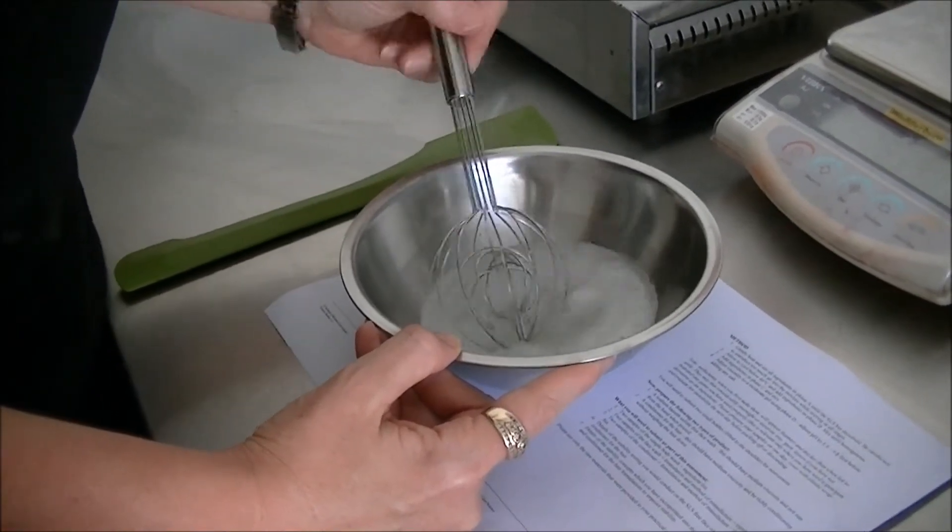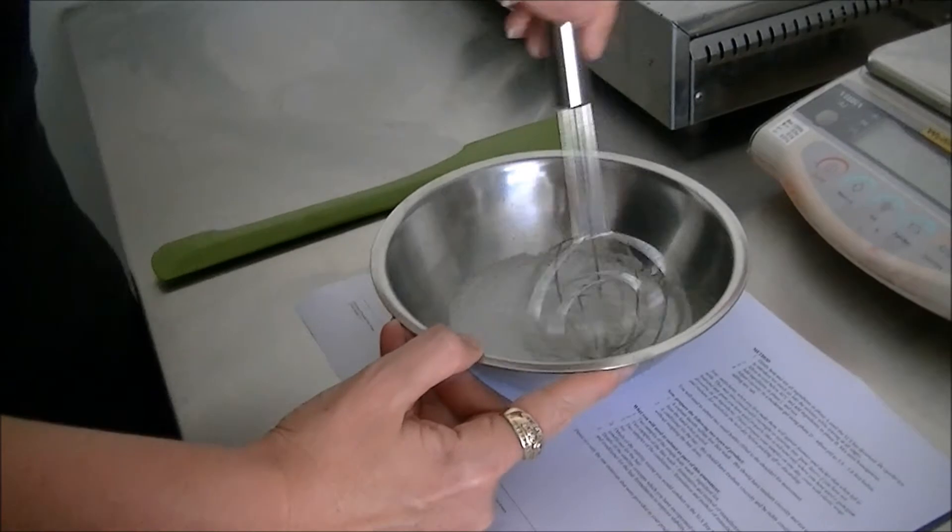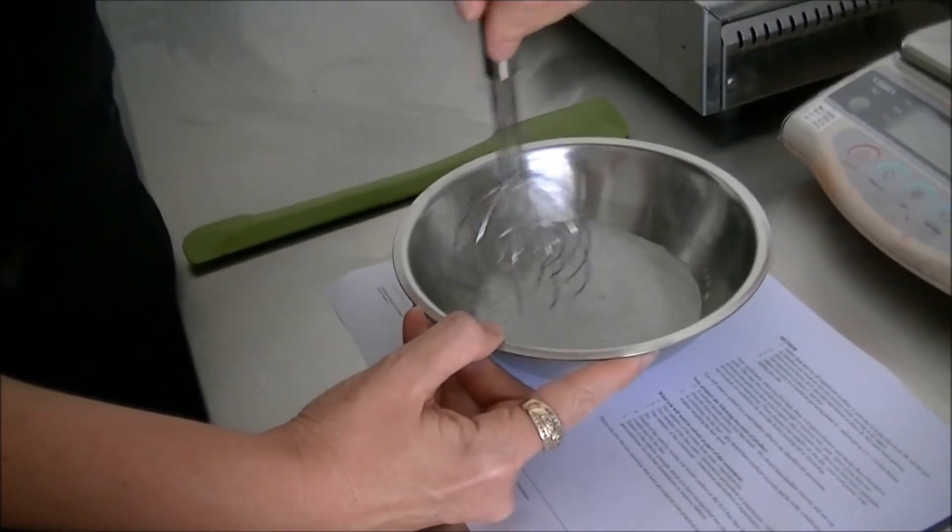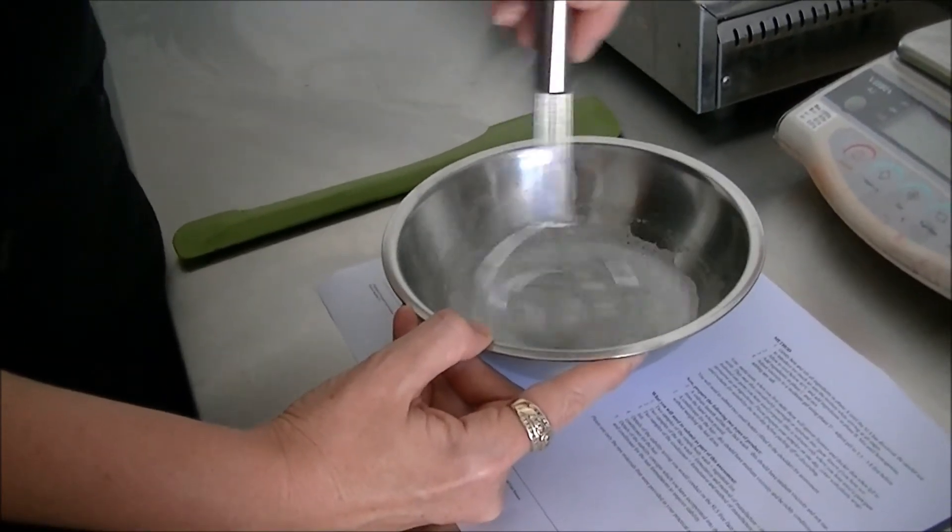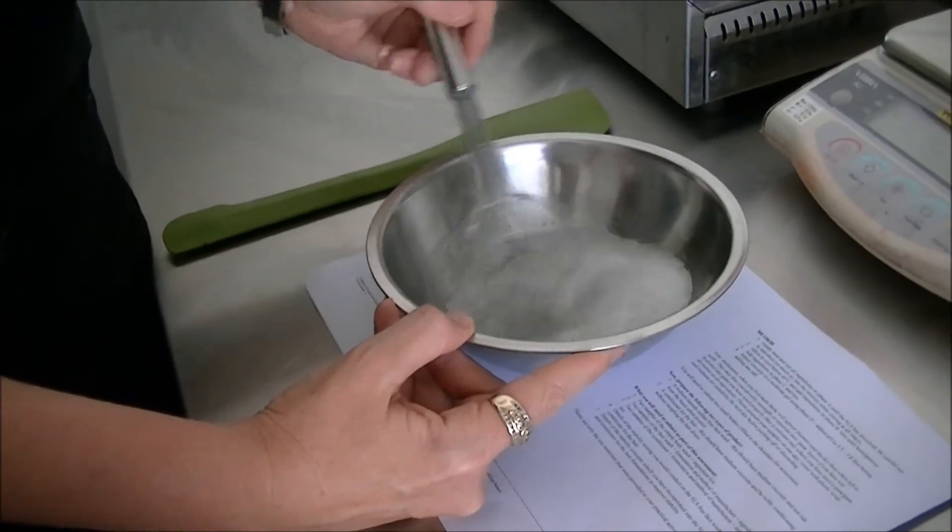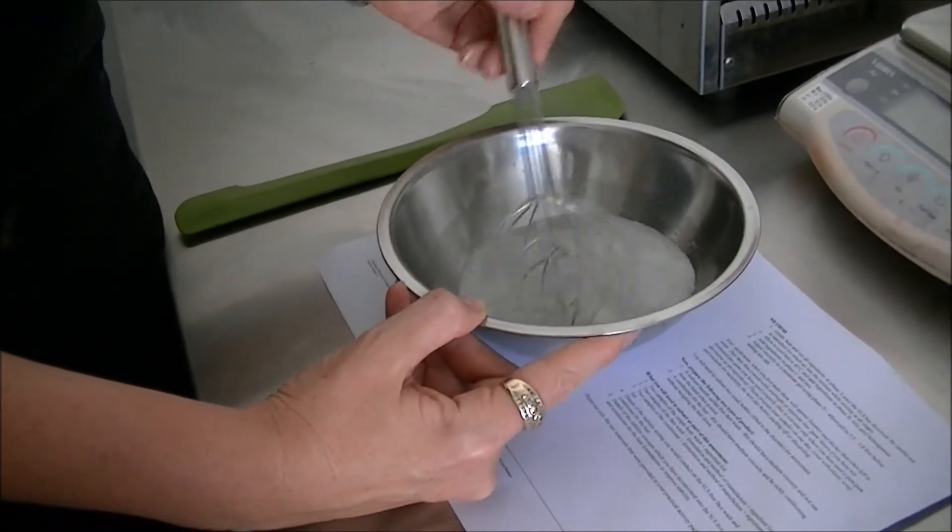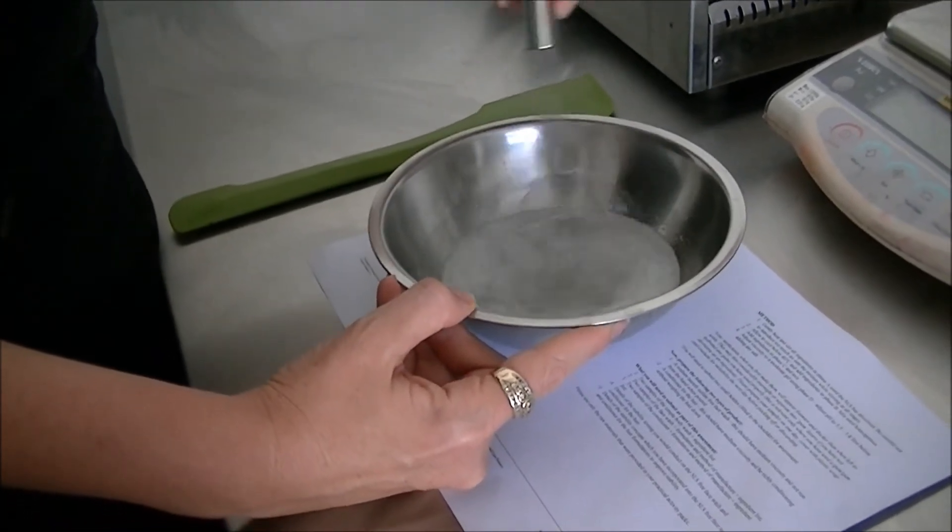So when we say heat gently that's a typical example. We're keeping that heat reasonably low and controlled. Not like when we're trying to create an emulsion where we need to melt waxes. This is more just to help with dissolving.